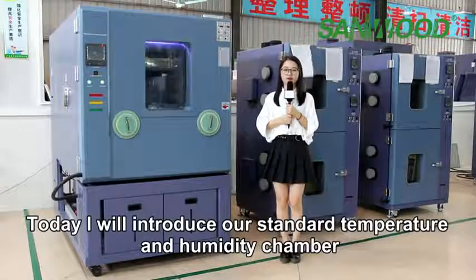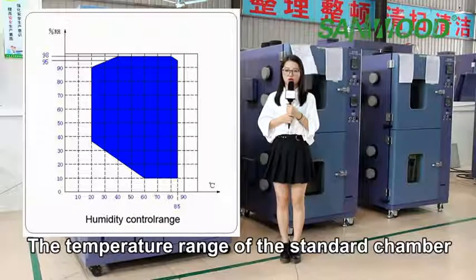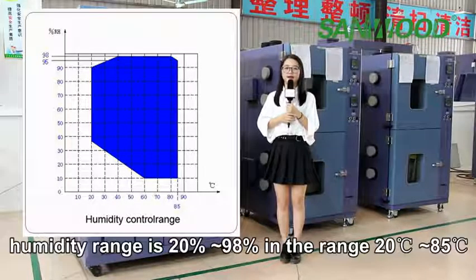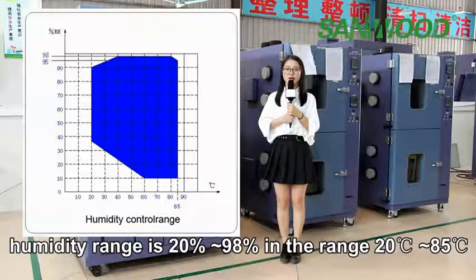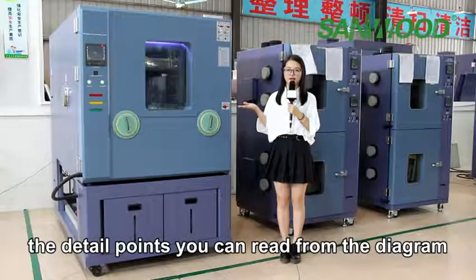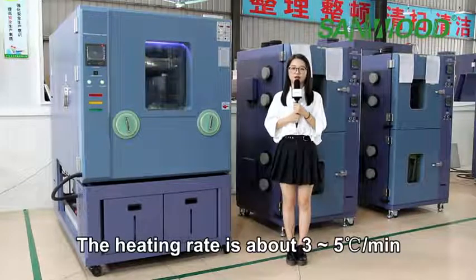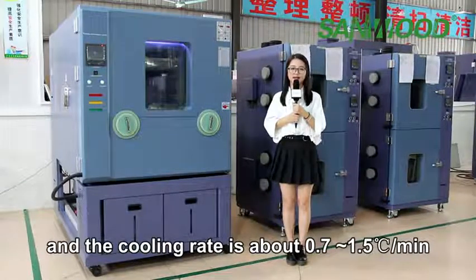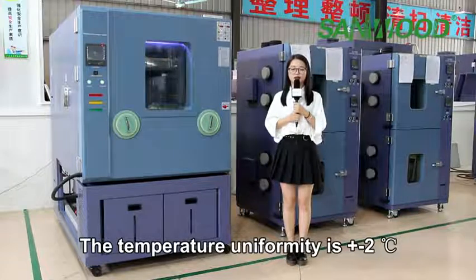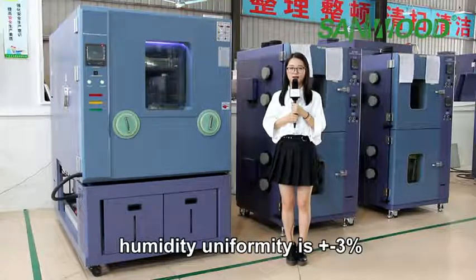Today I will introduce our standard temperature and humidity chambers, which is the most common. The temperature range of our standard chambers is -70 to +150 degrees. And the humidity range is 20% to 98%. At the range of 20 to 85 degrees, you can read more detailed points from our diagram. The heating rate of our chamber is 3 to 5 degrees per minute, and the cooling rate is 0.7 to 1.5 degrees per minute. The temperature uniformity is ±2 degrees, and the humidity uniformity is ±3%.